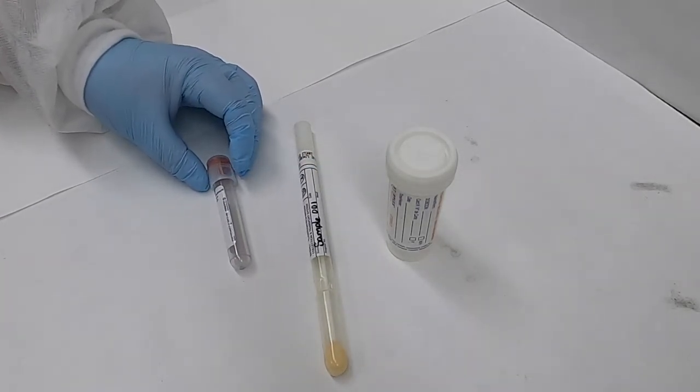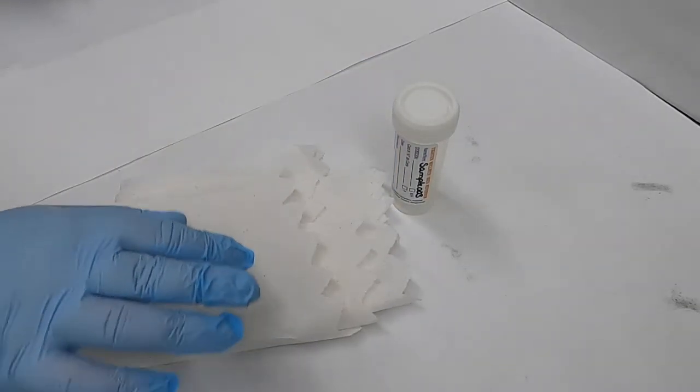So whether your sample is a plastic tube, a swab, or a blood sample in a glass tube, this should give you an idea of how we need to package samples for shipping.